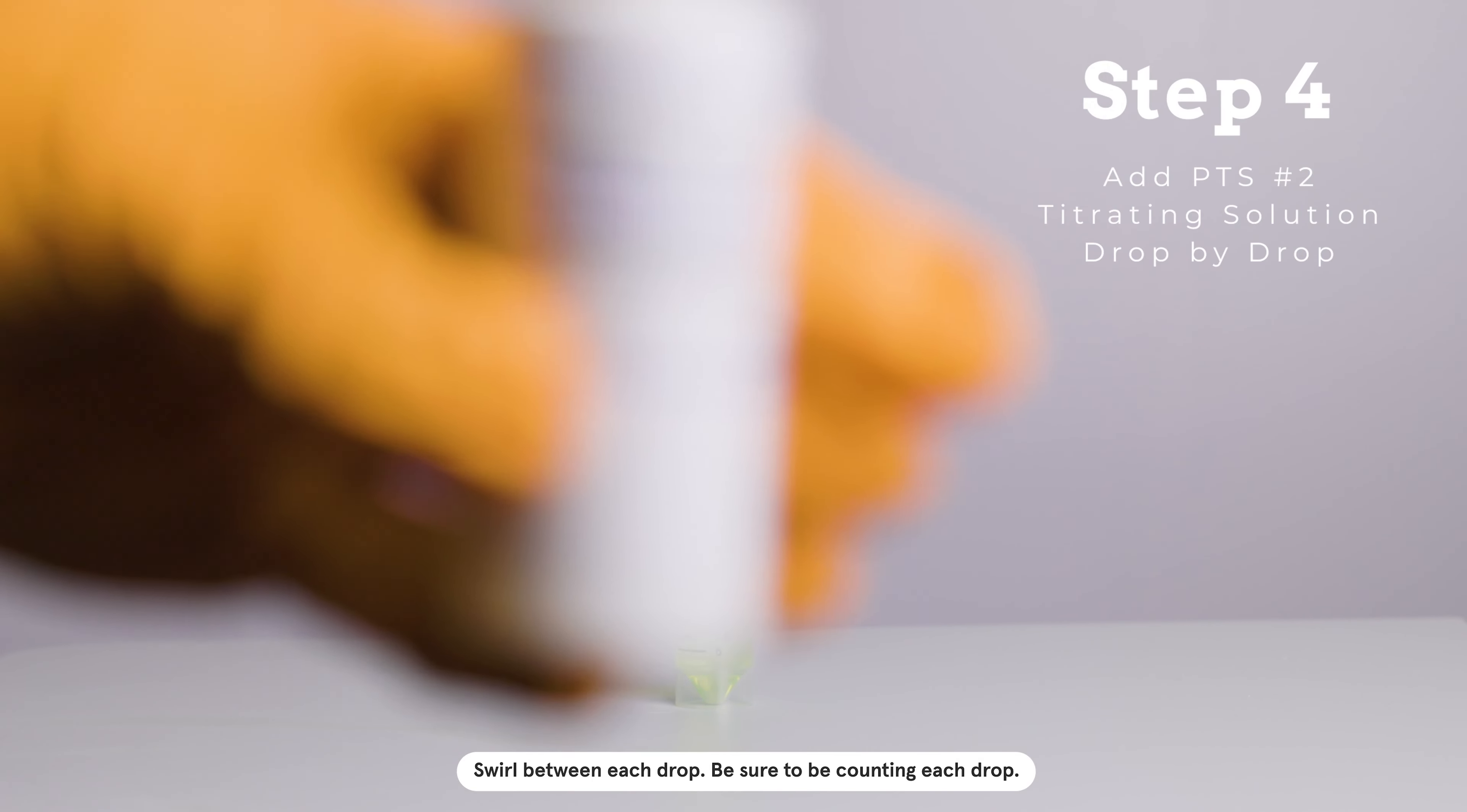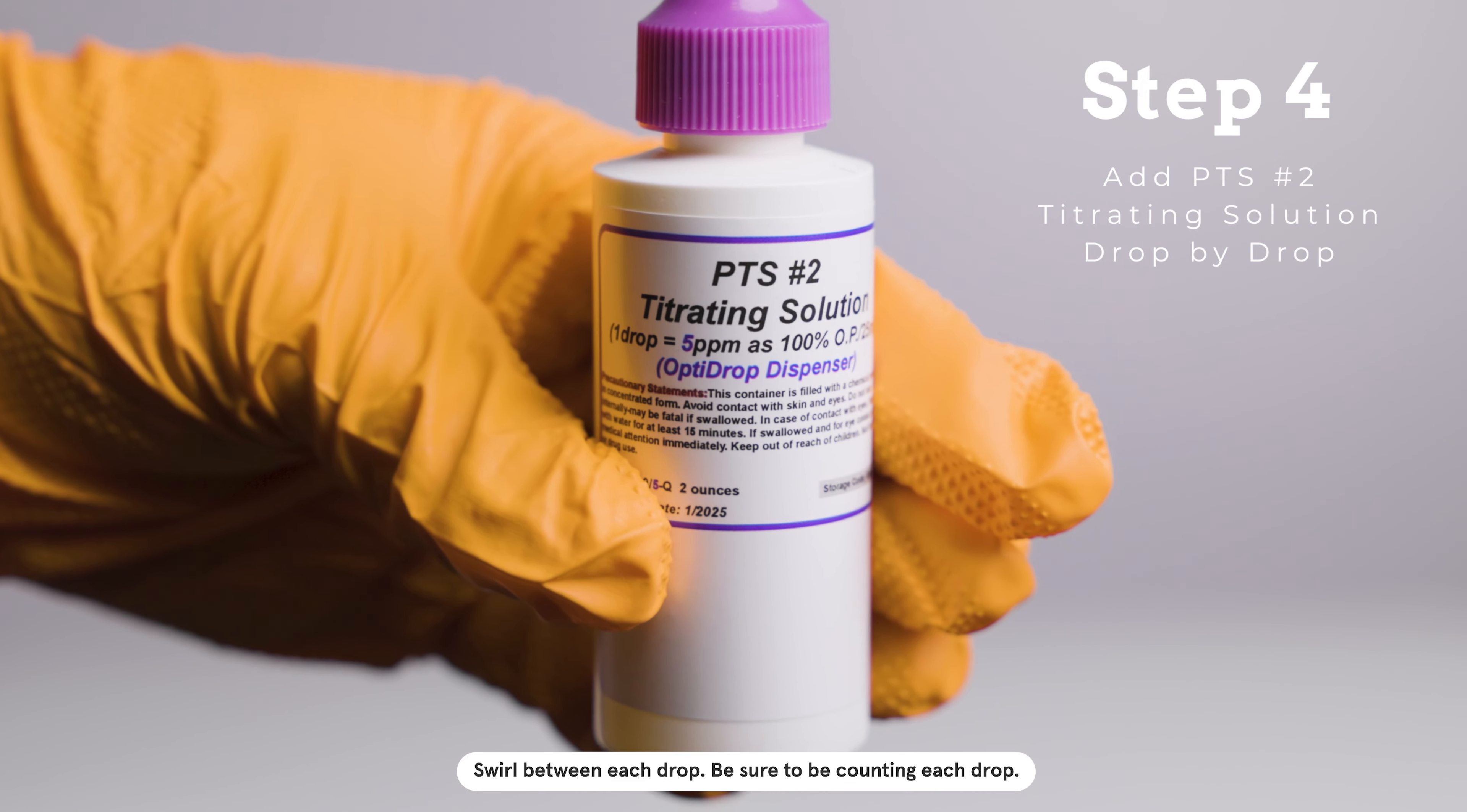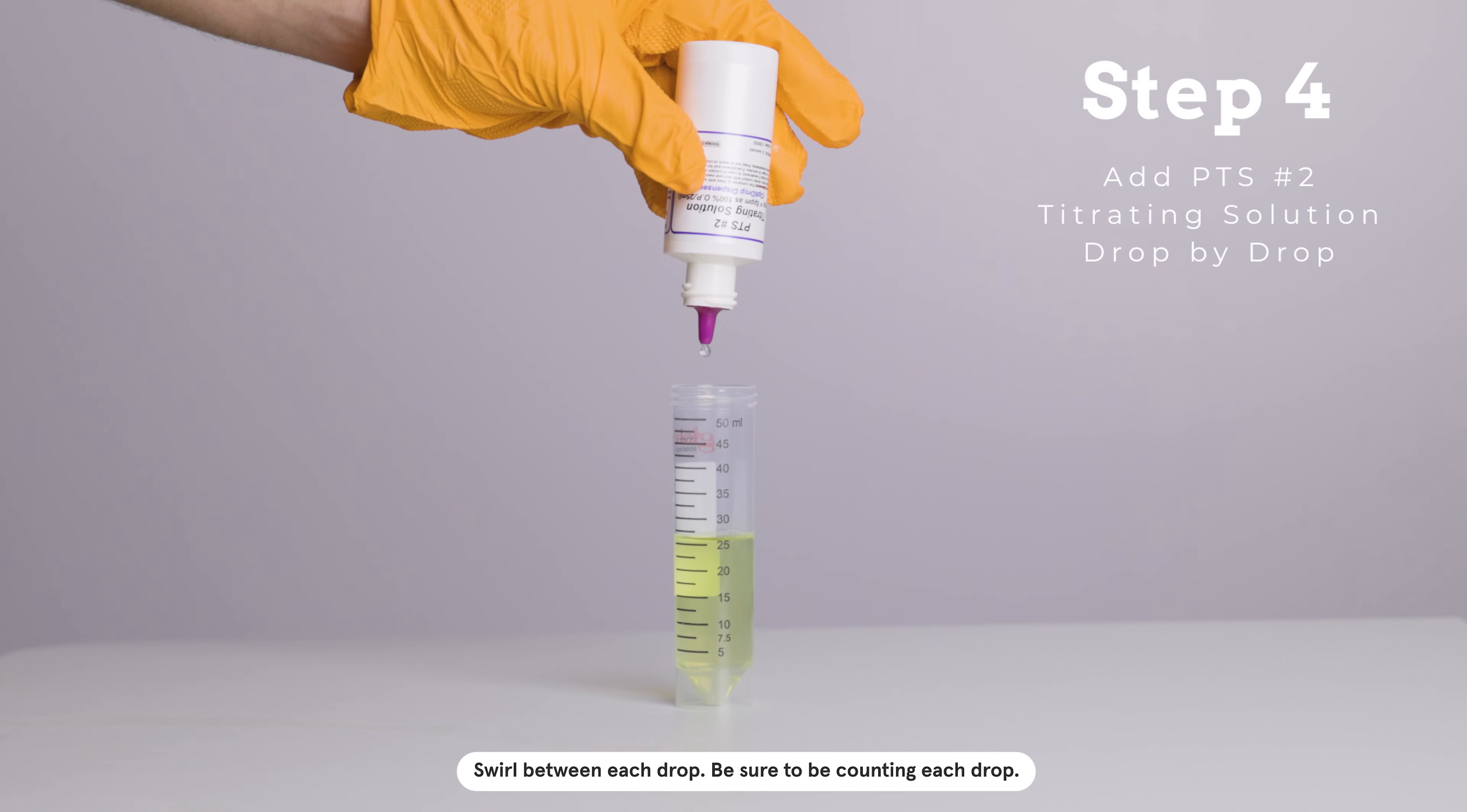Step 4. Add PTS No. 2HR Titrating Solution. Be sure to be counting the drops until the water turns to a permanent purple or violet color.